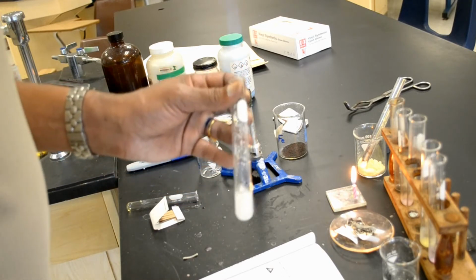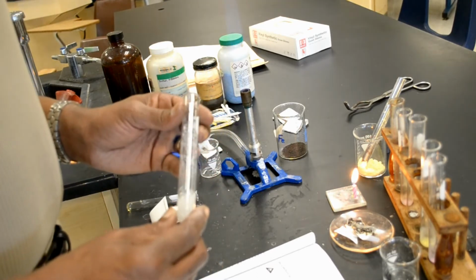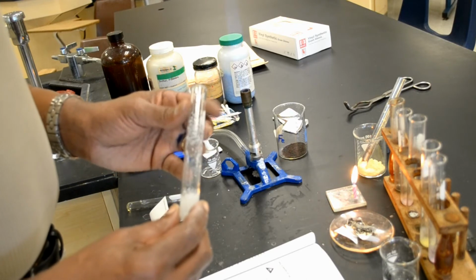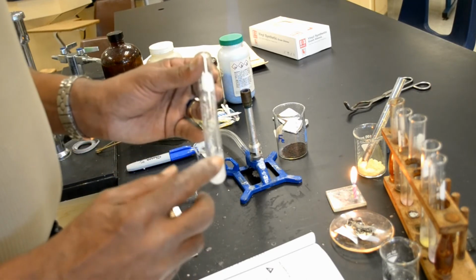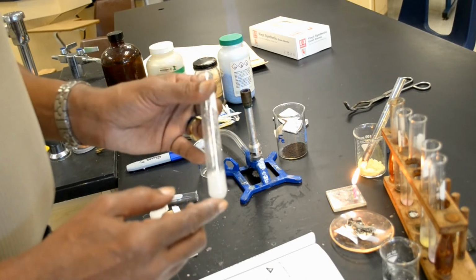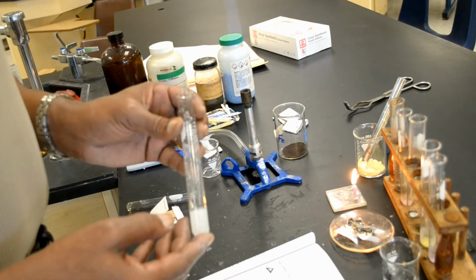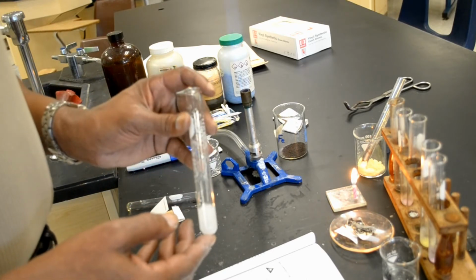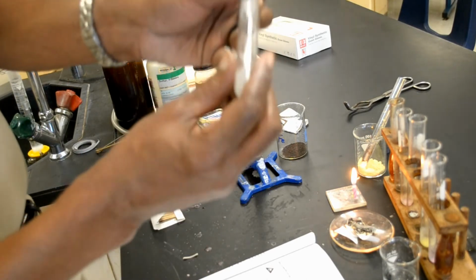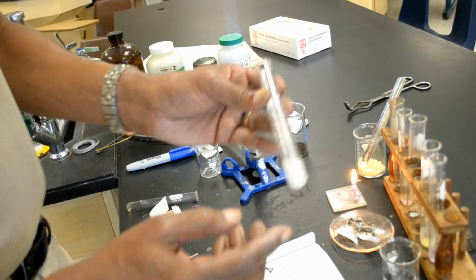But by adding another chemical, such as silver nitrate, to the water-salt mixture, I formed a new compound. This compound is called silver chloride. The reason that you can actually see the silver chloride in the water is because silver chloride doesn't dissolve in water. It is insoluble. And you can see on the bottom the silver chloride precipitate.